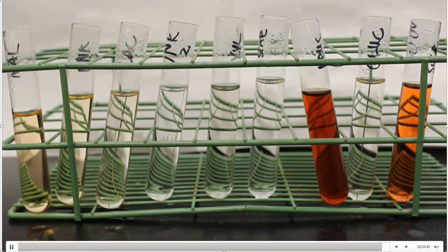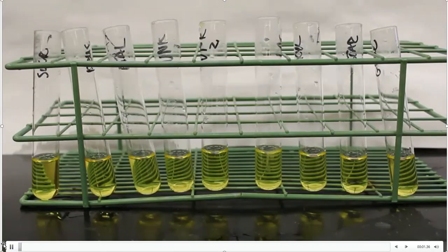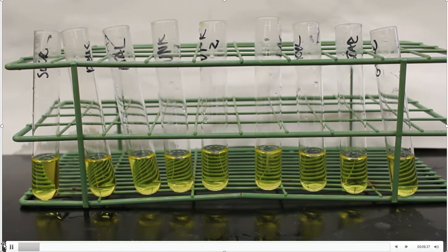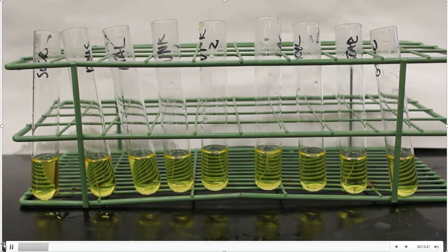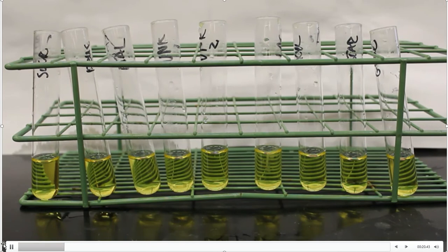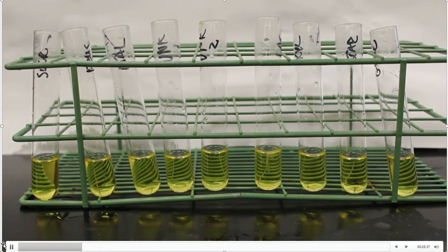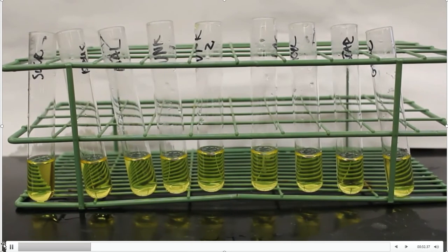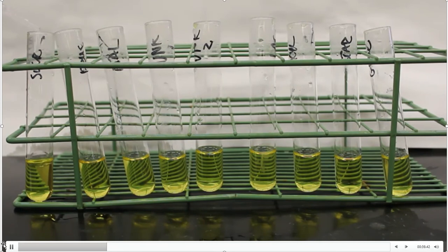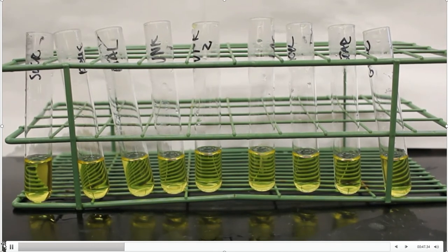So we're probably at the very last qualitative test for carbohydrates, and that is the Bial's test. It tells me to put three milliliters of the reagent in the test tube — and that's what I've done. You can see that the Bial's reagent does have a slight color associated with it. Then it tells me to add a couple of drops of each carbohydrate. The very first one is sucrose — two or three drops. One, two, three. There's sucrose. The second one is fructose — a couple of drops.